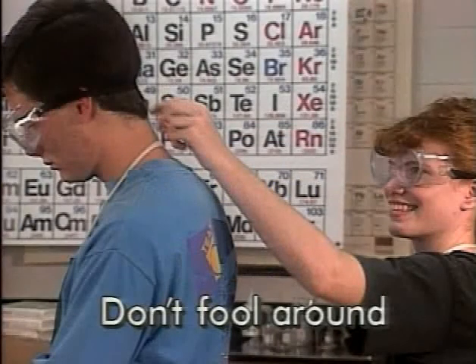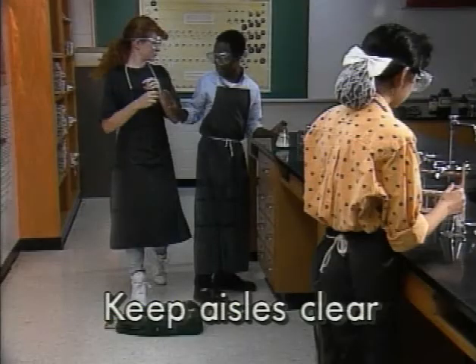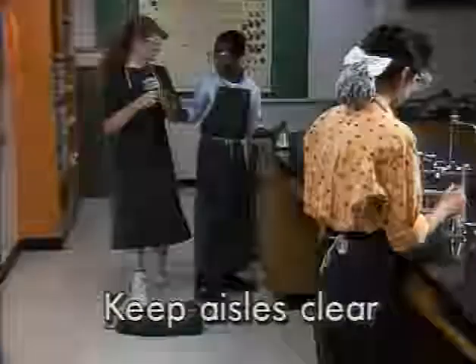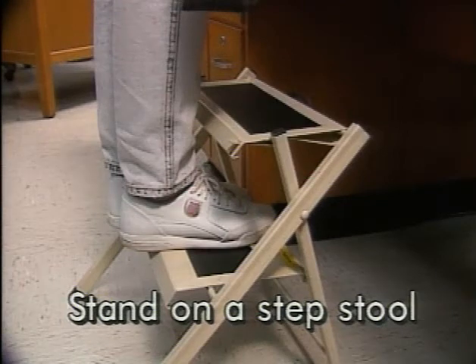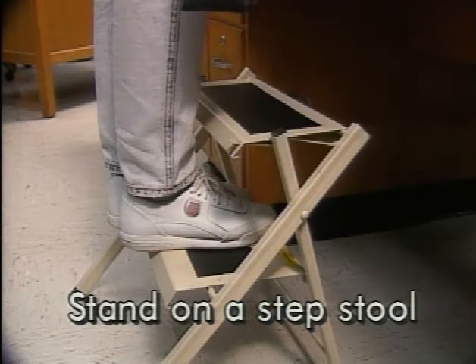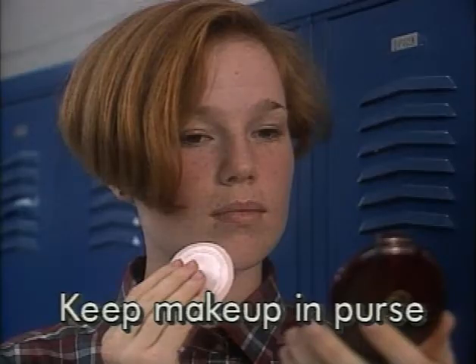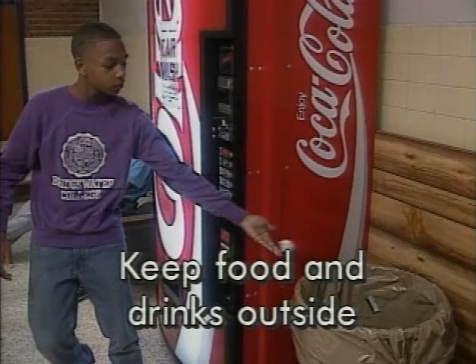Behavioral safety summary: don't fool around in lab; keep aisles clear of personal belongings; stand on a step stool when you need to reach; keep makeup in your purse; keep food and drinks outside the lab.